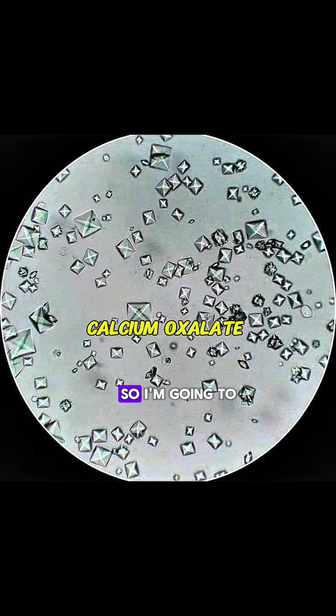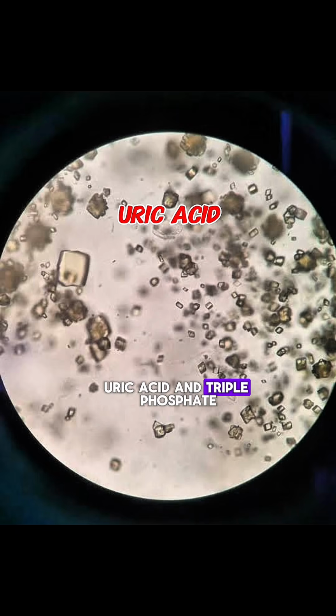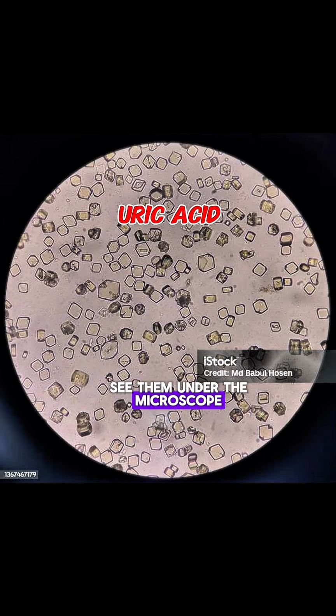Next are the crystals. So I'm going to show you different types and shapes of calcium oxalate, uric acid, and triple phosphate so that whenever you see them under the microscope, you won't get confused.